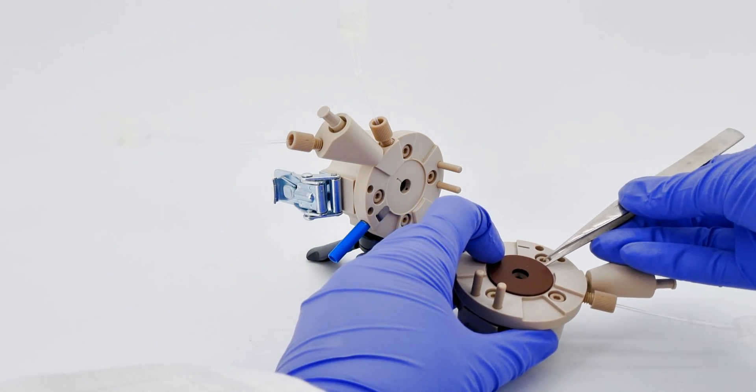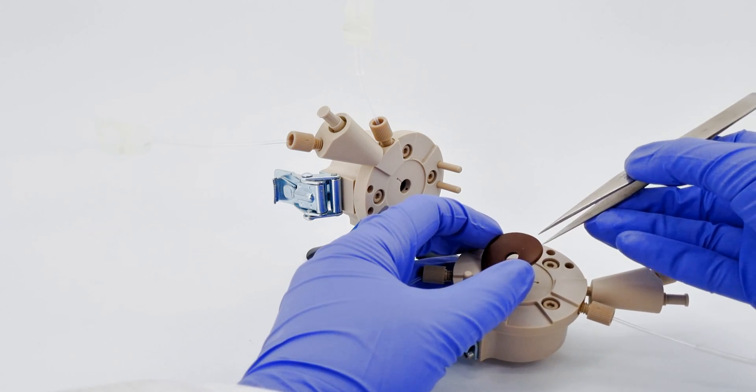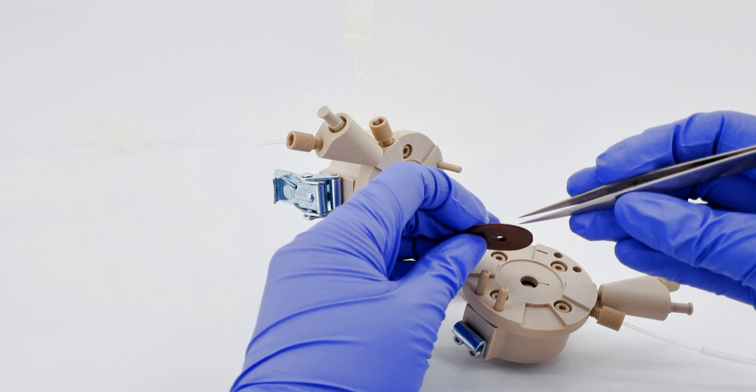If the gaskets give you a bit of a struggle, a pair of tweezers works wonders. After separating them, make sure to place the gaskets back in their original positions.